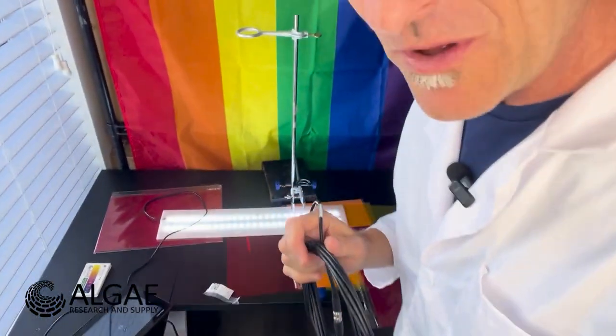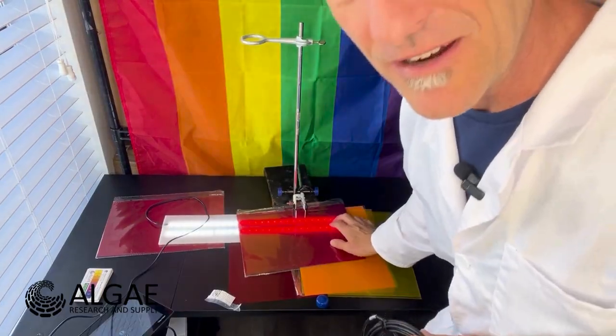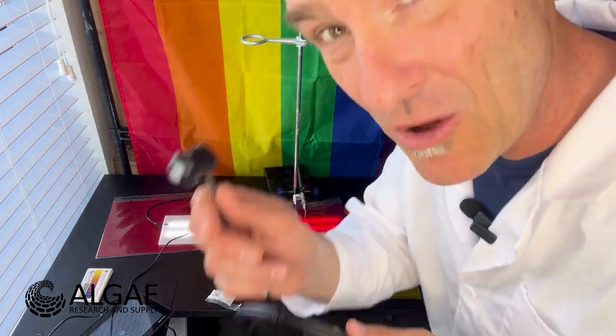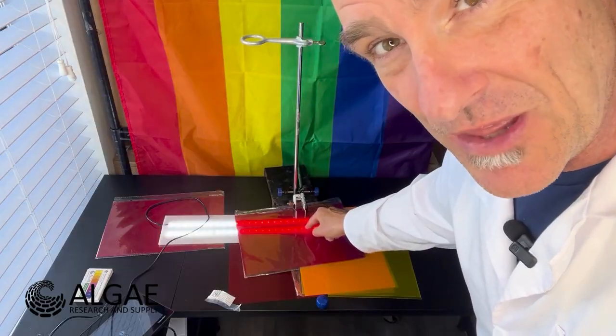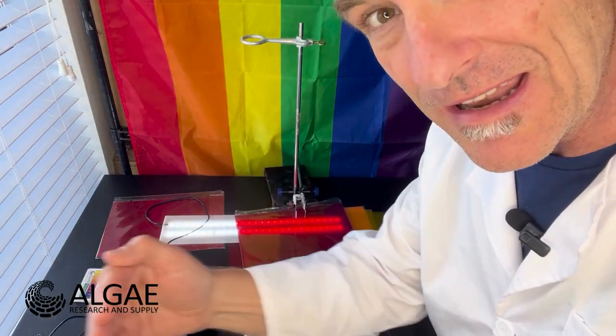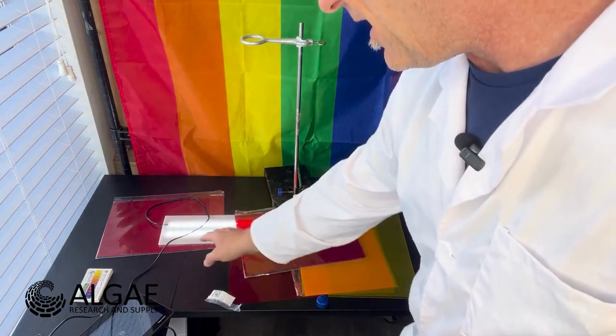Down here, I'm going to rig this onto this light stand, and I'm going to put the different wavelengths of light down here, or the filters on here, so that we can actually count the number of photons that make it through this filter, so that way we know how much light is coming in PAR as a function of each one of these filters. And so we're going to put them all on there, find out which one has the smallest amount of light going through it, and then we're going to put on extra layers of filter for the ones that have a lot more light coming through. That way we can normalize it all to the minimum number of flux of photons through these screens. Lots of work, but it's really cool.